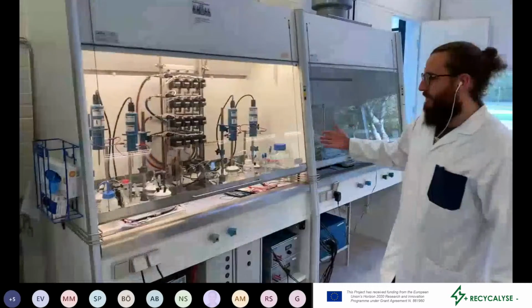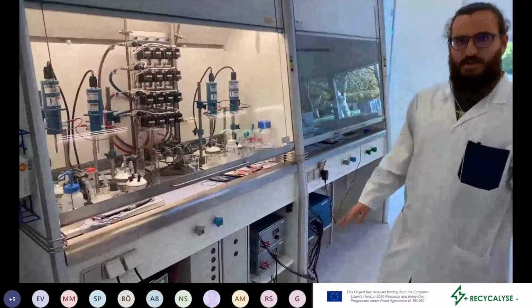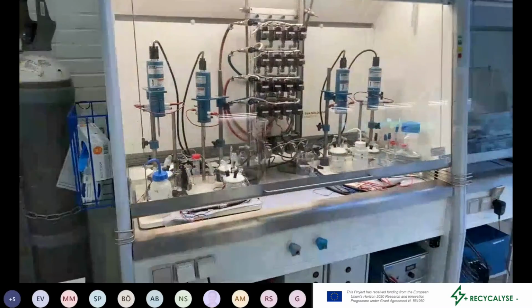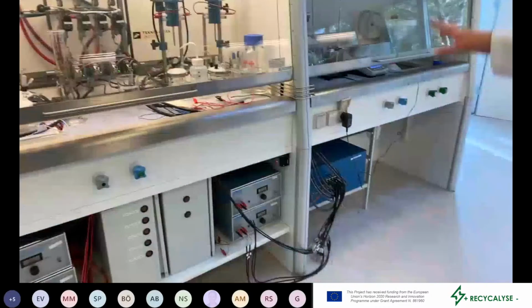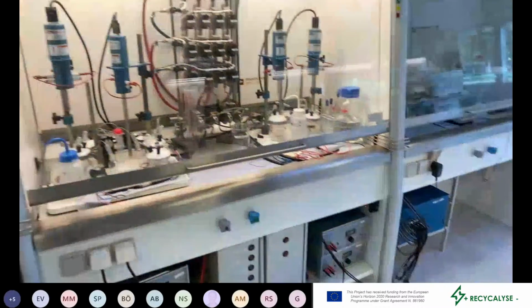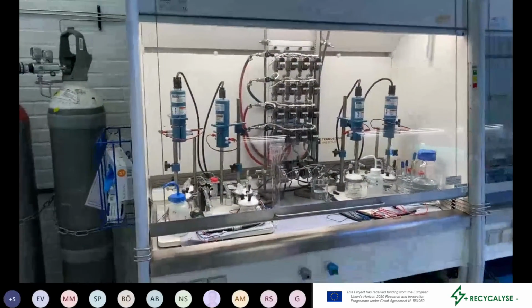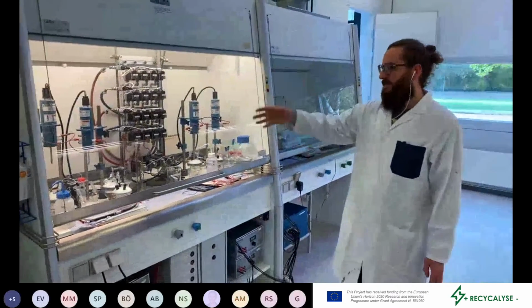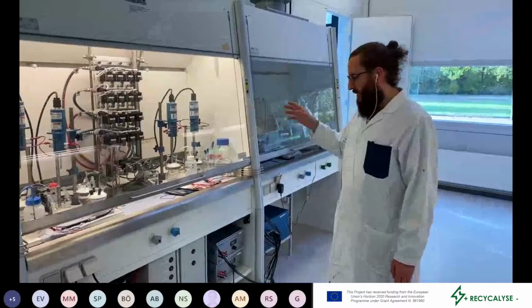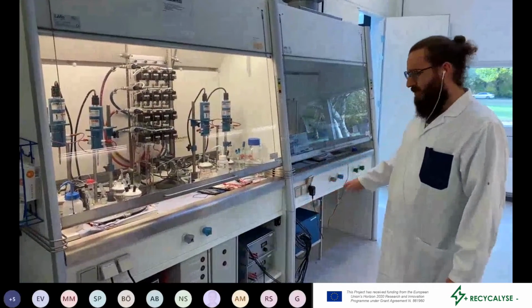Here we have our electrochemistry testing bench, where we have 4 independent RDE setups that are controlled with one potentiostat down here. The 4 channels can actually be run independently from each other and in parallel. Each one of them has their own gas supply. So ideally, we can set up one measurement, set the gas supply, and control the rotation speed and everything with the potentiostat.